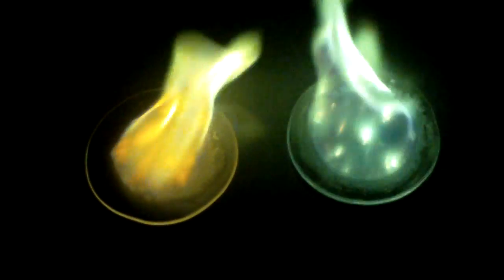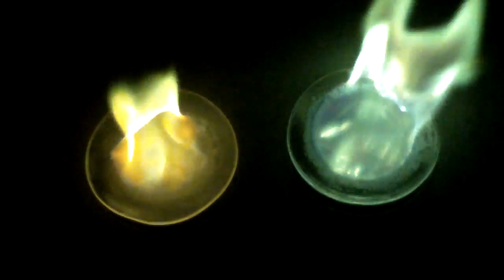There's some yellow or orangish in both of them from sodium contamination. This can be solved with the addition of cobalt glass to the camera, but I don't have any, so sorry.